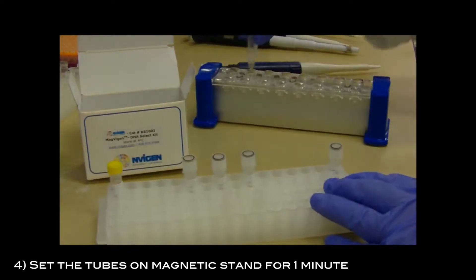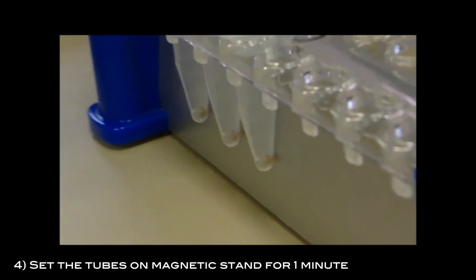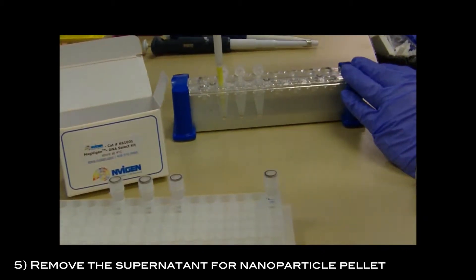Set the tubes on the magnetic stand for one minute. Remove the supernatant from the nanoparticle pellet.